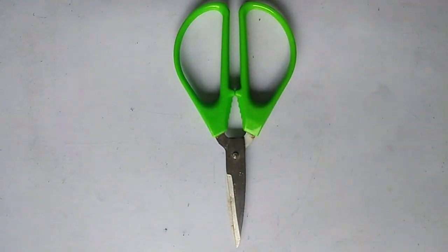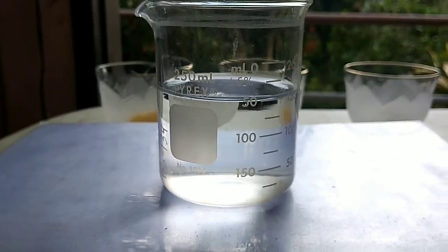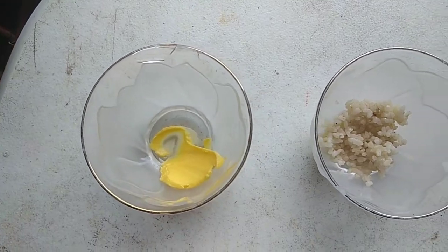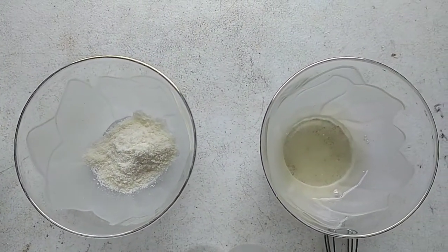In this activity, you will need a brown paper bag, a scissor, a dropper, teaspoon, small container, a marker, a plastic lab apron like this, disposable gloves, and food samples, such as what I use: margarine, bread, egg white, perhaps, and milk. So let's dive in.